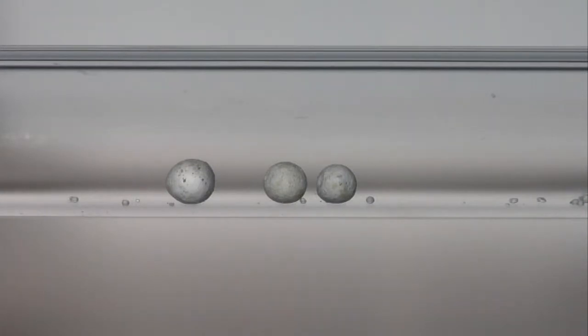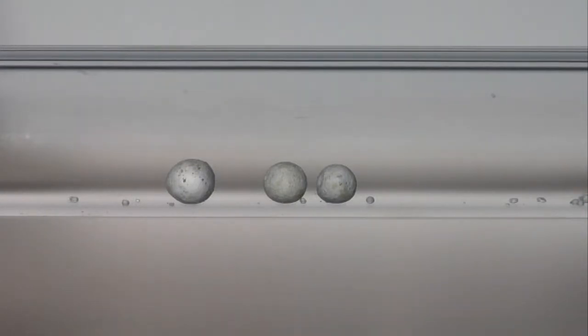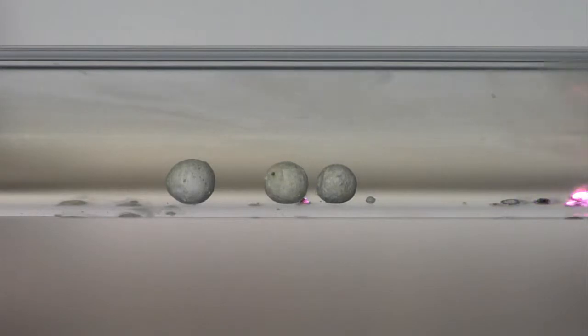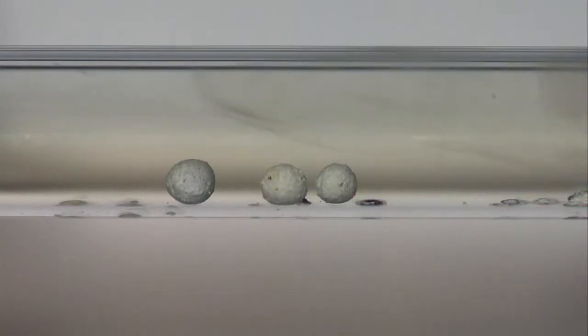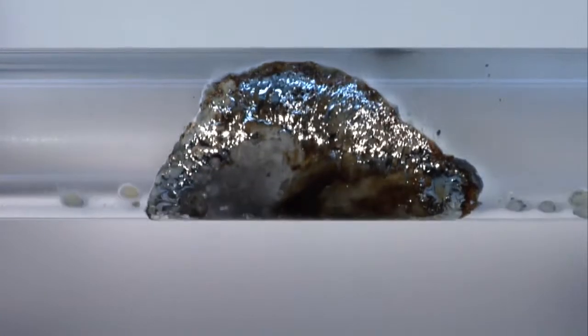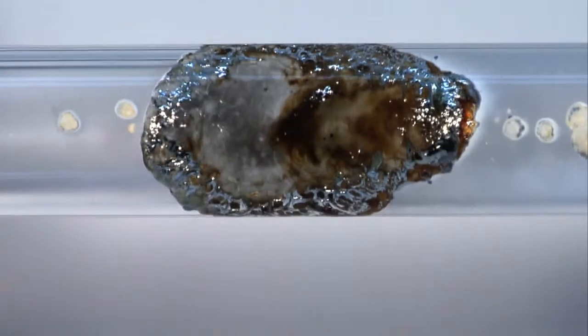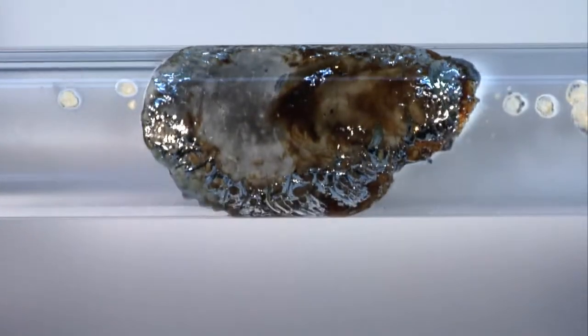Chlorine from a cylinder is used for this reaction. The metal, which has been cleaned and stored under argon, spontaneously ignites in chlorine. Uncombined potassium remains as a thin film on the inner surface of the tube, insulated from the chlorine by a coating of potassium chloride.